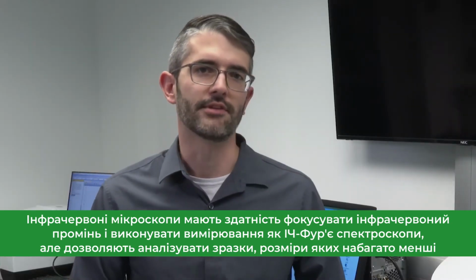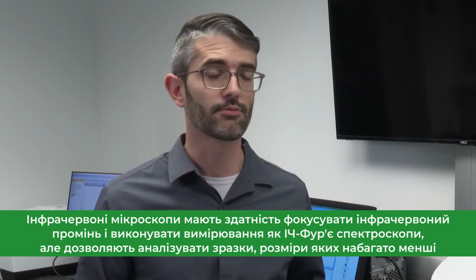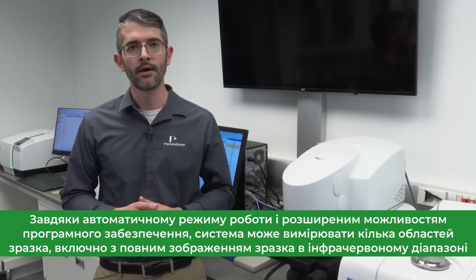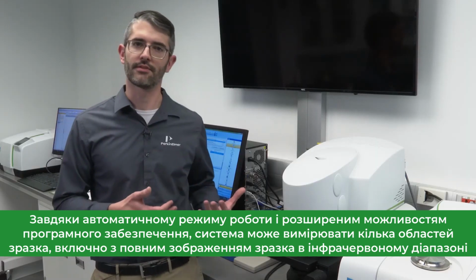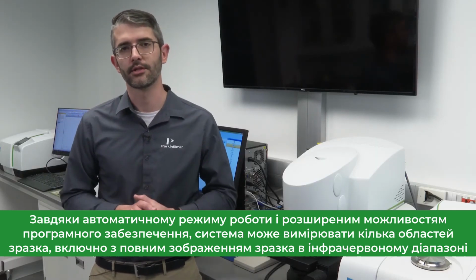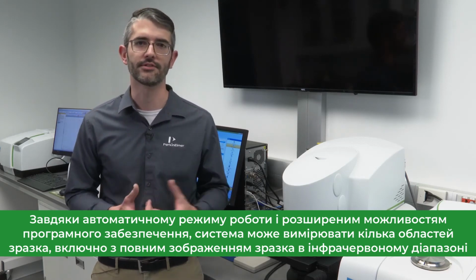Infrared microscopes have the ability to focus the infrared beam and perform infrared measurements such as those performed with a typical FTIR, except on a much smaller scale. Also, oftentimes automation is employed in the stage or in the software, which allows the system to measure multiple regions of interest, up to and including a full image in the infrared spectral range of the sample material.